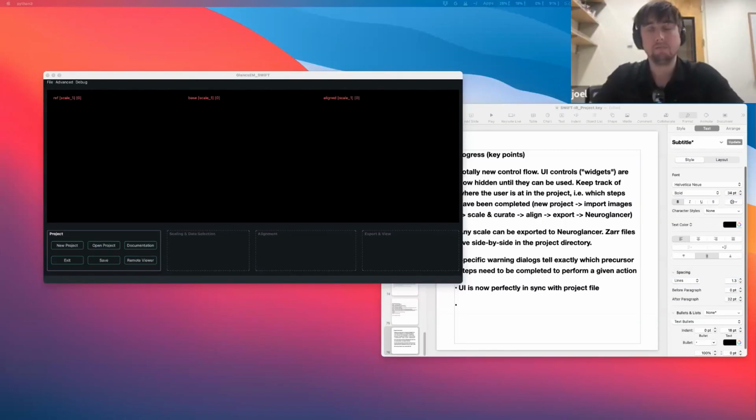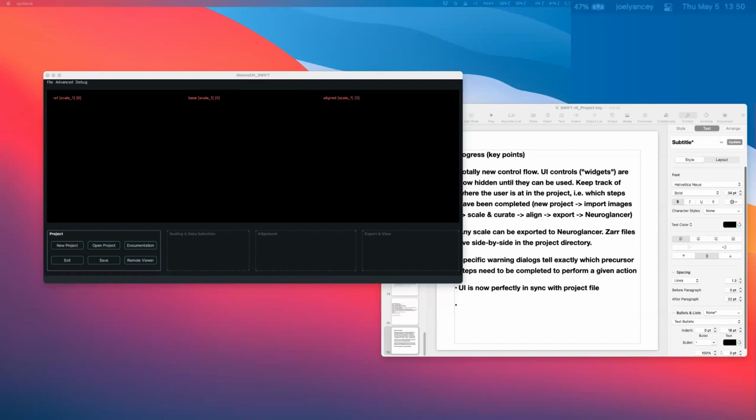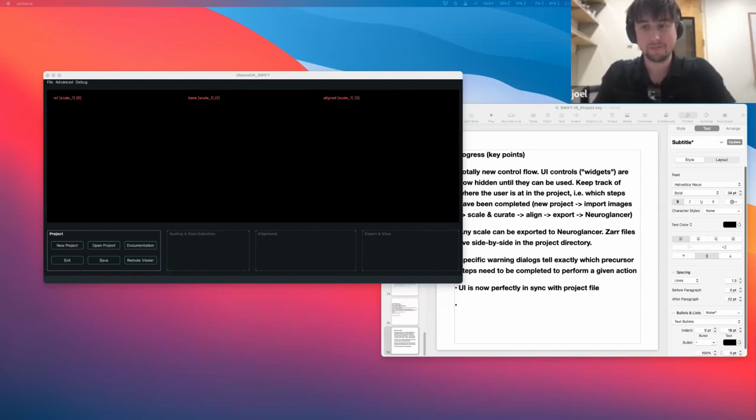Okay, I'm sharing my screen. Thanks for bearing with me, everybody. I just did something really dumb, which was to mess with permissions in my bin directory. Ultimately, I was able to solve it by reinstalling Anaconda and reconfiguring my environment. So I just wanted to present on some progress with regards to the SWiFT alignment app for aligning EM images.